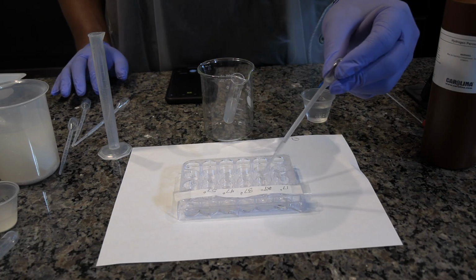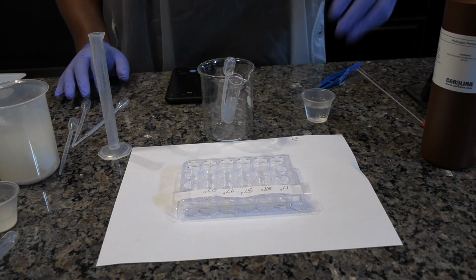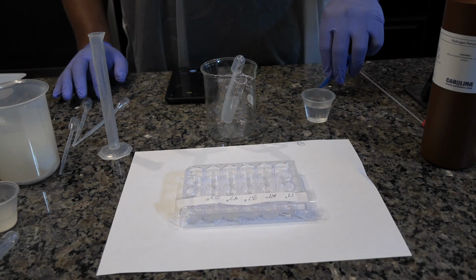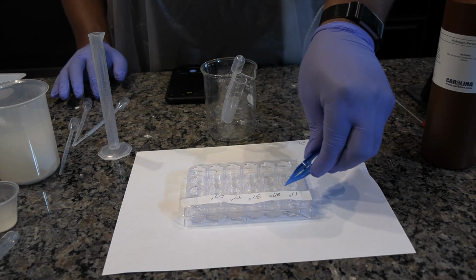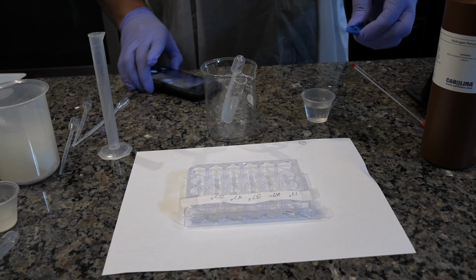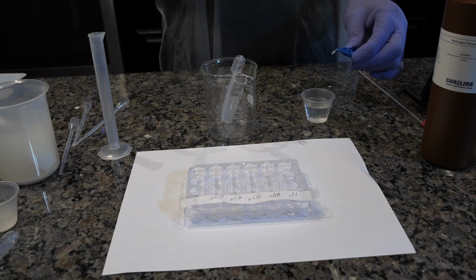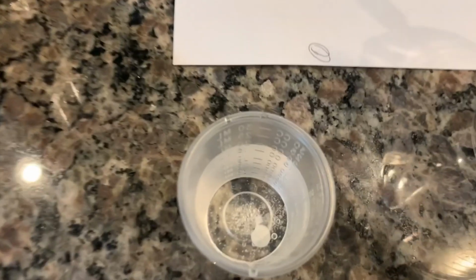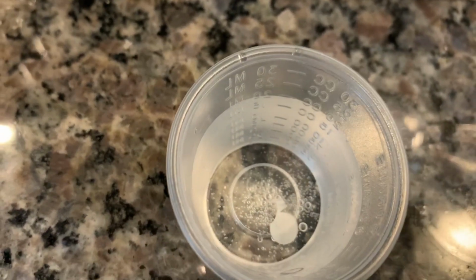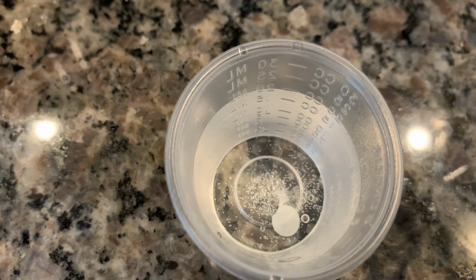Using the appropriate pipette, add 20 drops of room temperature catalase to the correctly labeled well. Soak a filter disc in room temperature catalase, blot and place it using the forceps at the bottom of the 1.5% hydrogen peroxide cup. Time how long it takes for the disc to rise to the surface and record the value in Data Table 2. Repeat for 2 additional trials.